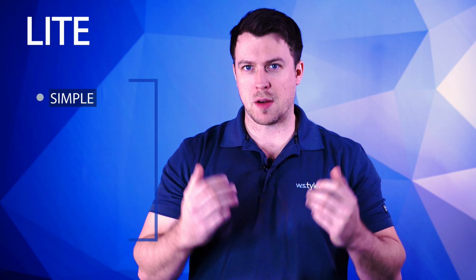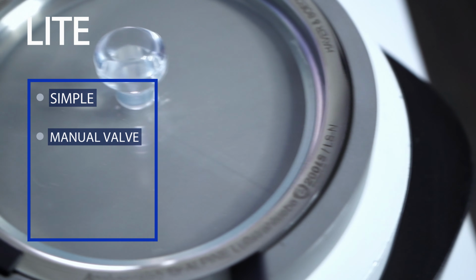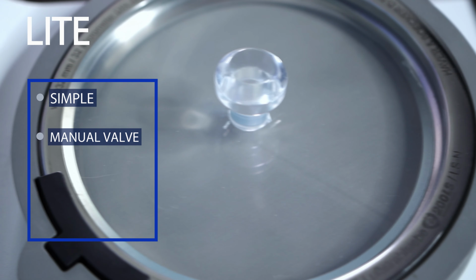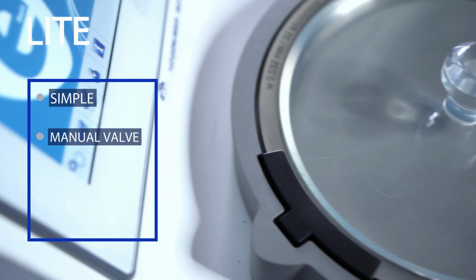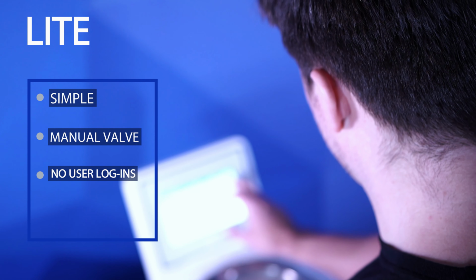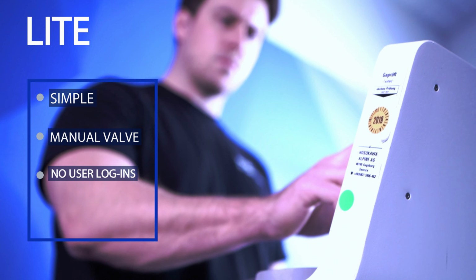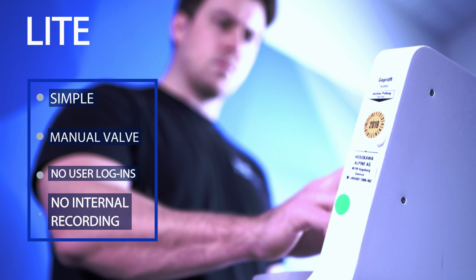Now with the Lite, you're going to have the most stripped down, bare bones version of software that you can use. There's no internal regulation of air pressure. There's a valve instead that you use to turn and manipulate how much air is getting into the instrument. There's also no user logins. You just press a play button, set a timer, and it reads out the air pressure that is being put through the machine. There's no internal recording with the Lite.